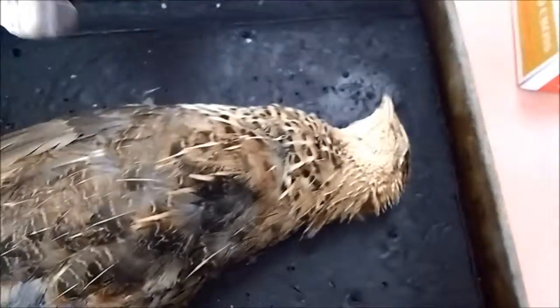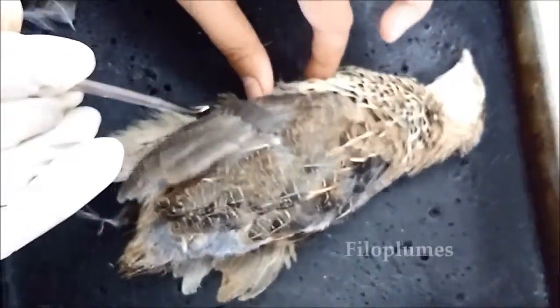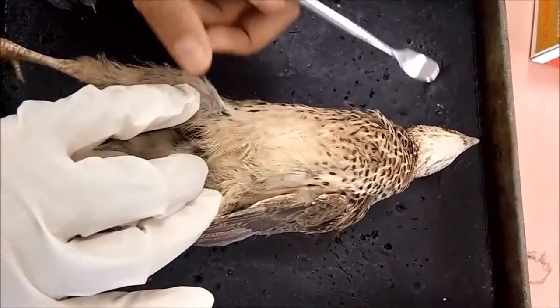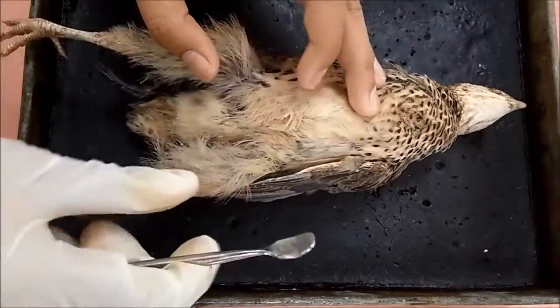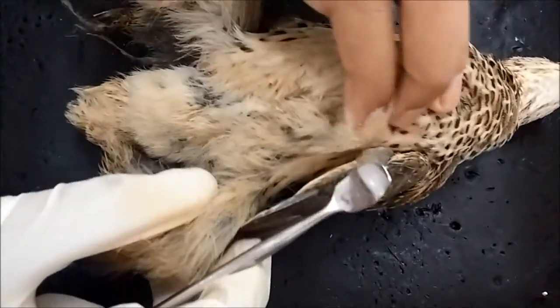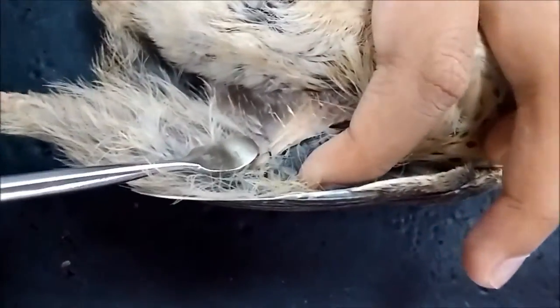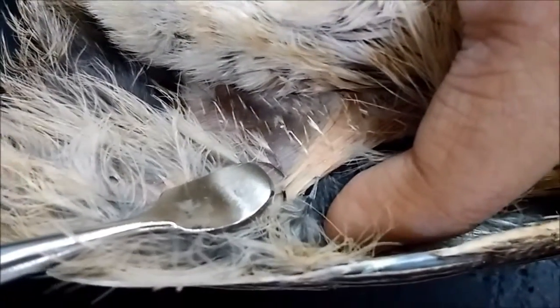And then lastly, the last feathers are the filoplumes, which are hair feathers. The hair feathers are small hair-like structures, vaneless, found underneath the contour feathers of the body. Each consists of a main axis with a few terminal barbs. For the filoplumes, we have to struggle a little bit to find them. This is the filoplume, which is a hair feather.